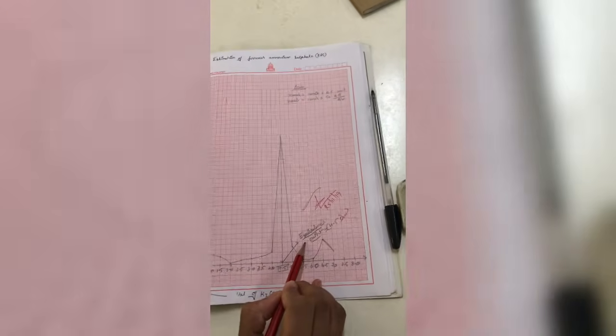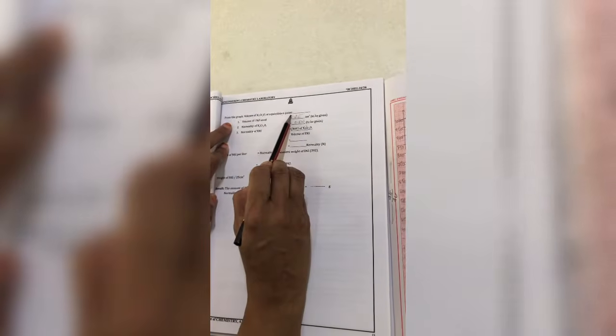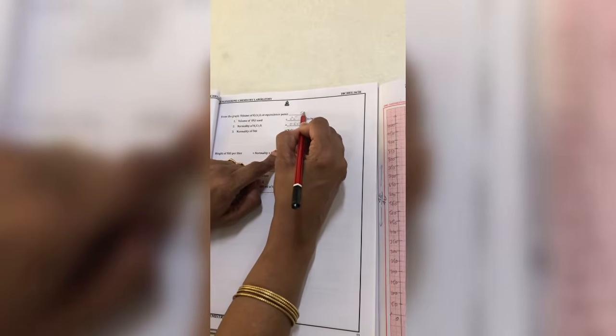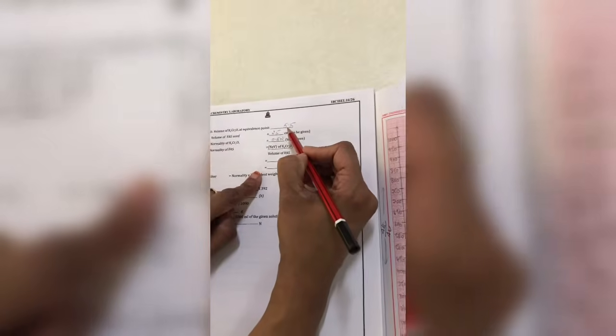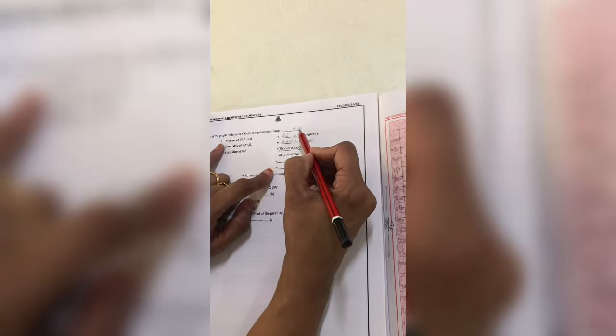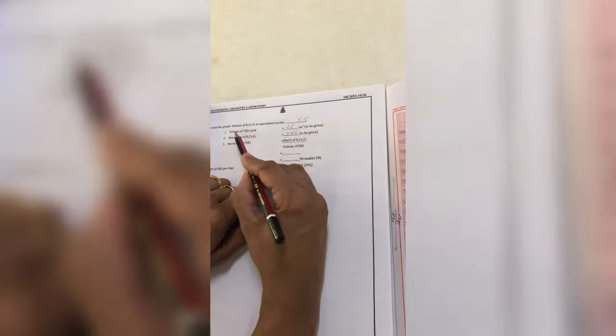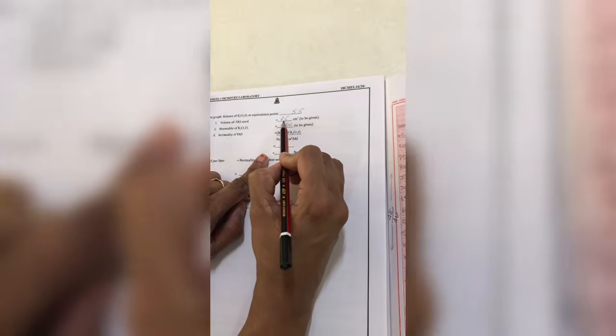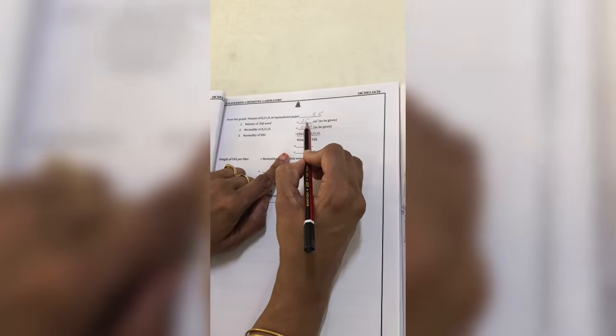From the equivalence point, now we have to do the calculation part. Coming to your manual book, after the tabular column you have the calculation part. In the calculation part, from the graph, note the volume of dichromate at the equivalence point, whether it is 4.5 or 5 or 5.5 or 6.5, whatever you are getting. Then the volume of FAS used is 25. All of you note it down. It is 25 cm cube, which I am giving you.